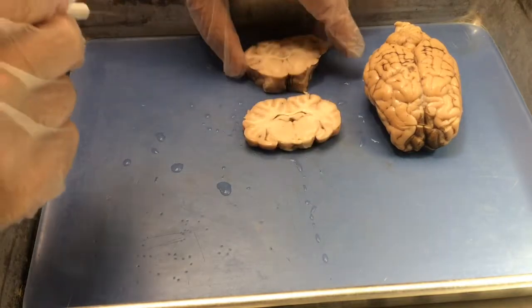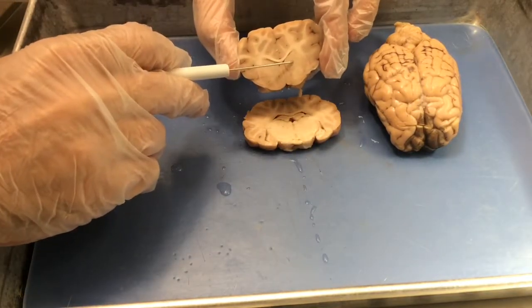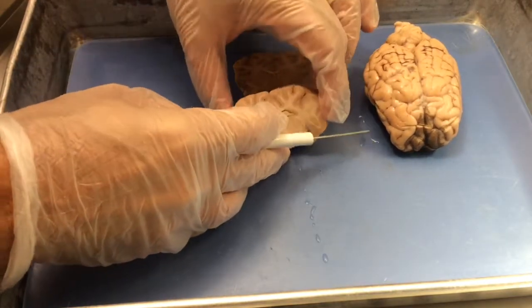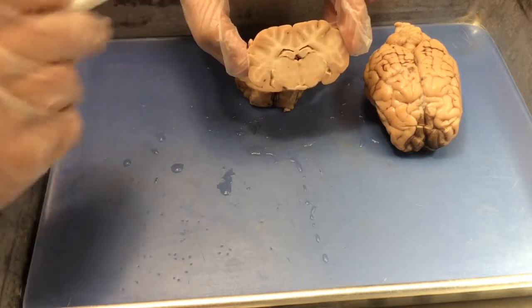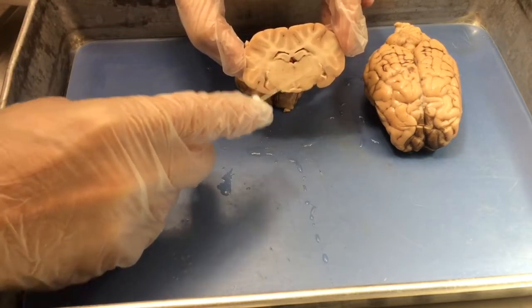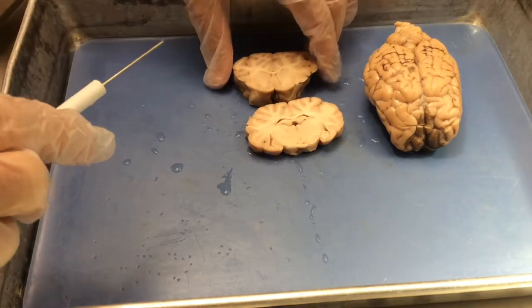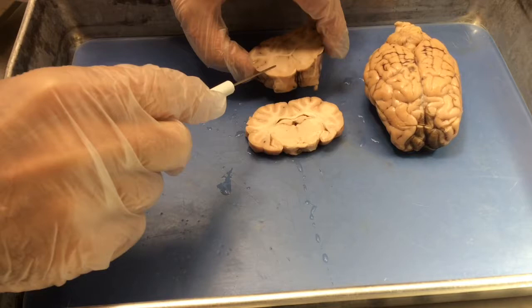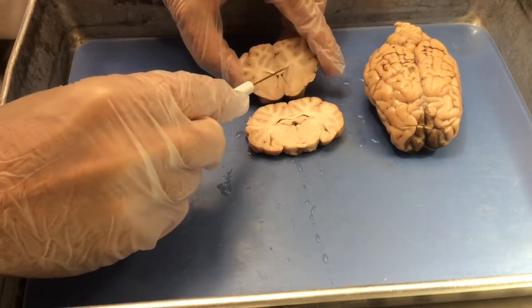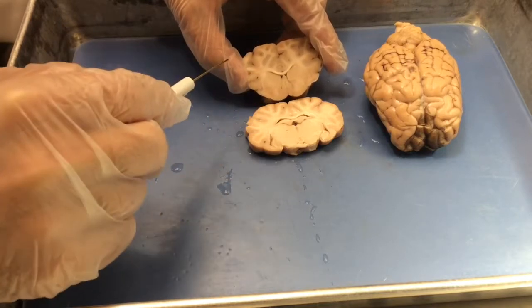Okay? It can be a little confusing discriminating the basal ganglia, which we find in this more anterior section, from the thalamus and the hypothalamus, which we find on this more posterior section. They look like egg-shaped structures. They're large structures of the subcortex. There's a couple ways to tell the difference. One is the basal ganglia appears lateral to the lateral ventricles. So here we have a lateral ventricle. Lateral to it, that gray matter is basal ganglia.